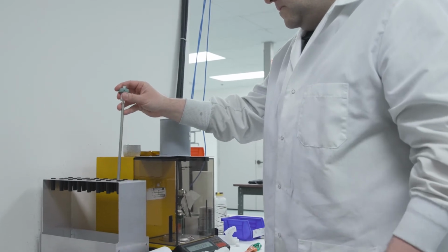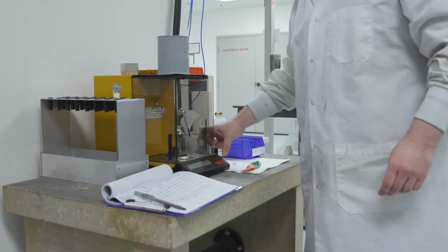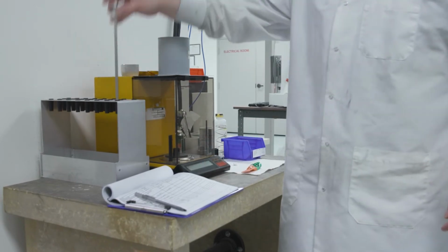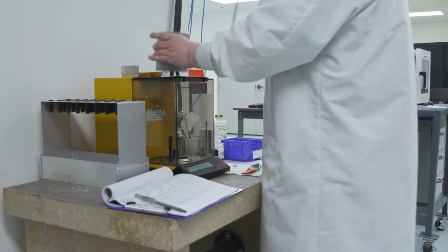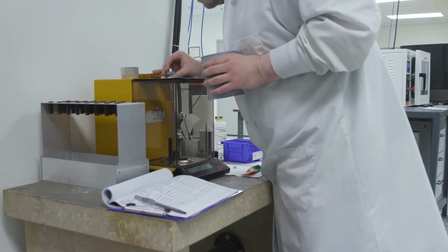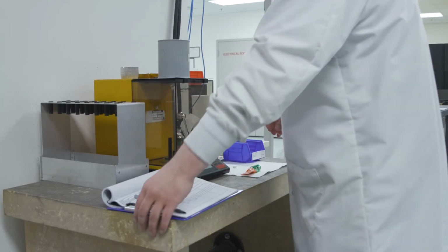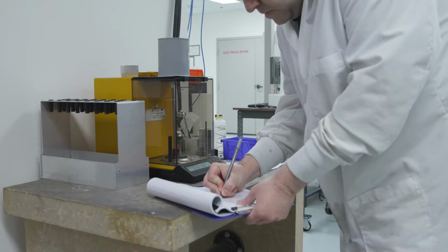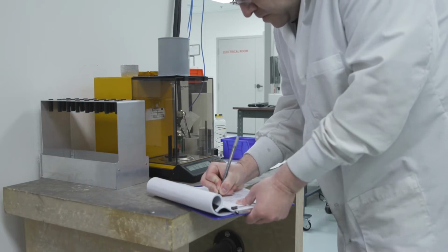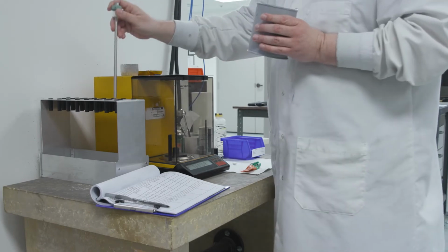The mass of the penetrometer is needed to determine the sample densities, and since the amount of grease used each time may vary, a new penetrometer mass is needed for each analysis. Chris will tare the penetrometer weighing support on the balance and record the mass of penetrometer plus sample. He will subtract the sample mass to obtain the penetrometer mass. The sample is now ready for analysis using the AutoPore.